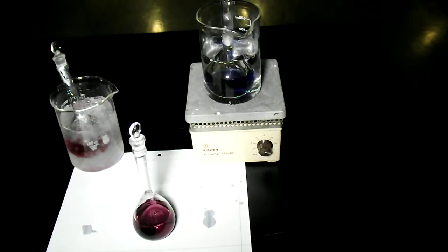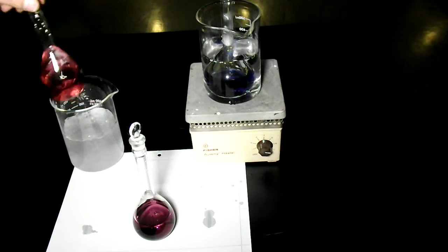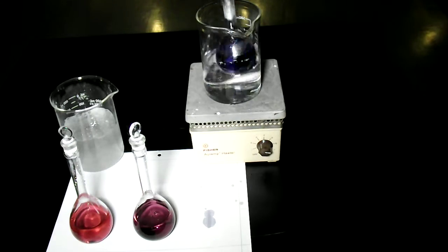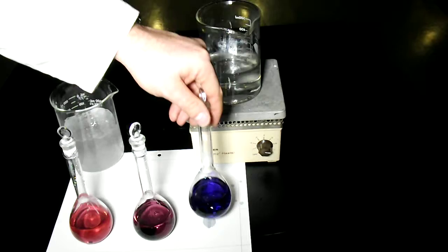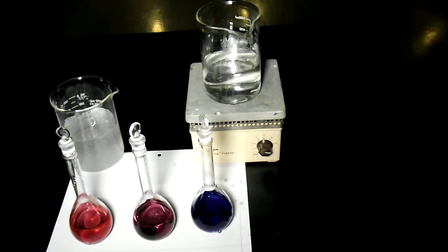So now, since the time is just about up, if I take them out and we look at them, we can see that there is a significant change in color.